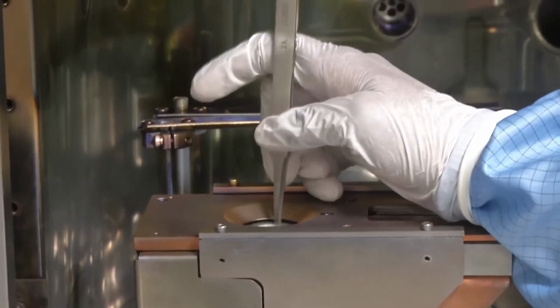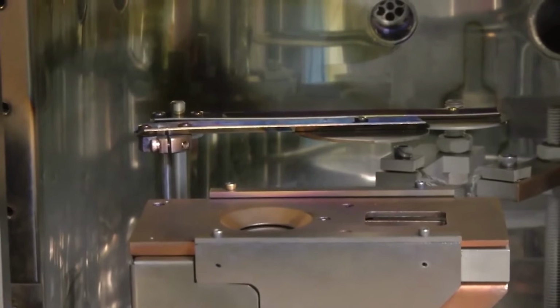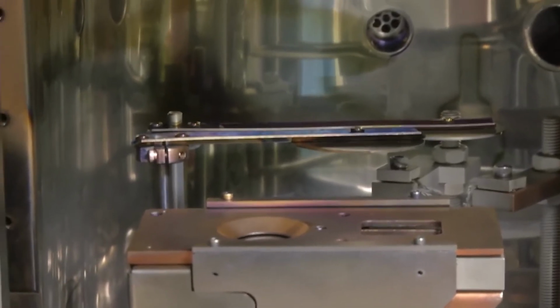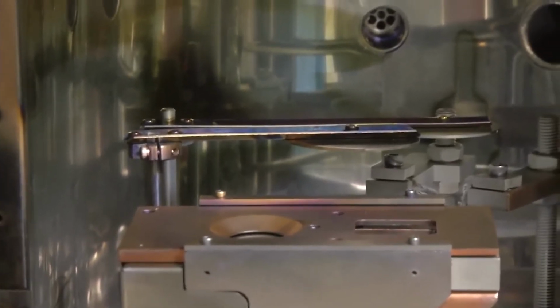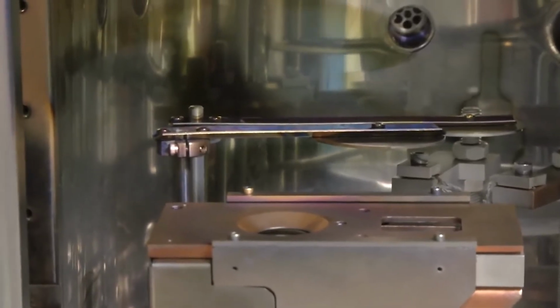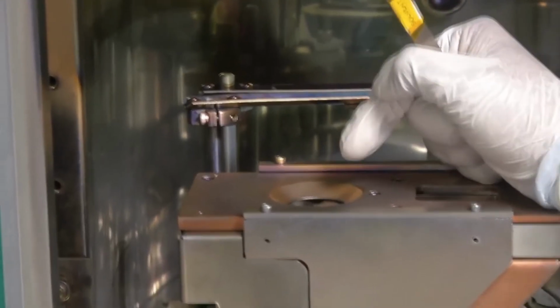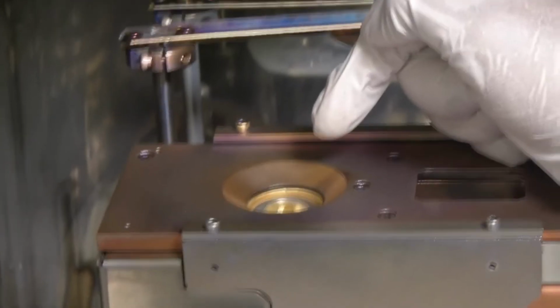This is how a crucible is loaded, and one other feature of any electron beam evaporator is that there are multiple crucibles dedicated for individual metals available in different slots. My colleague will demonstrate how, by using a control operation from the system electronics, we can change to the crucible containing a different metal.